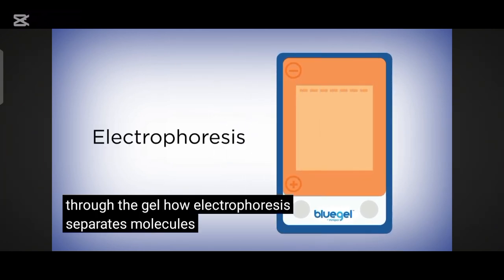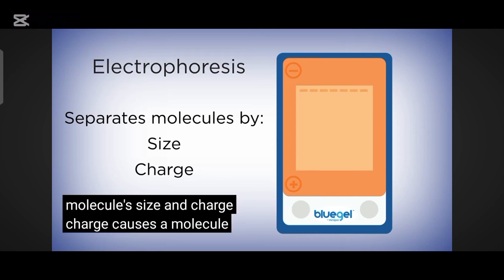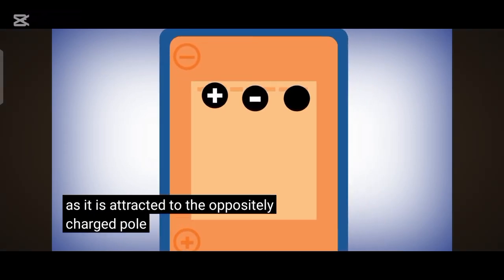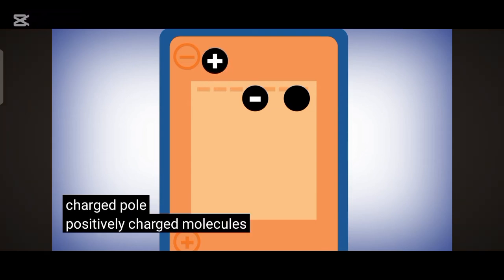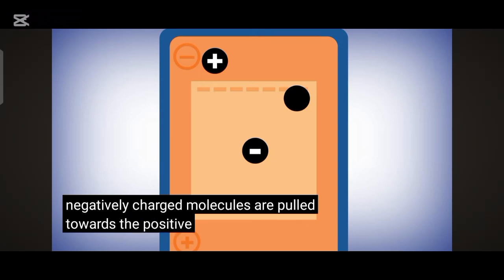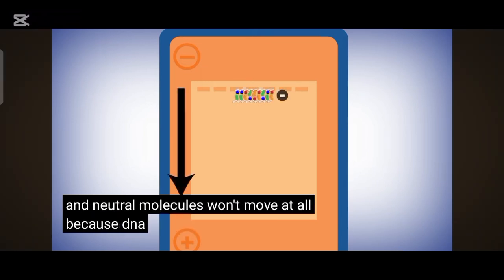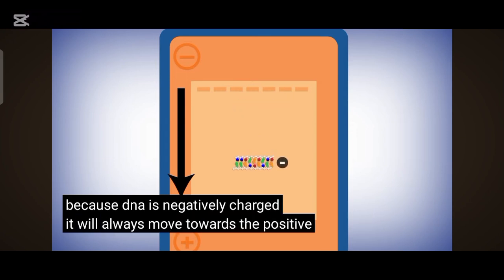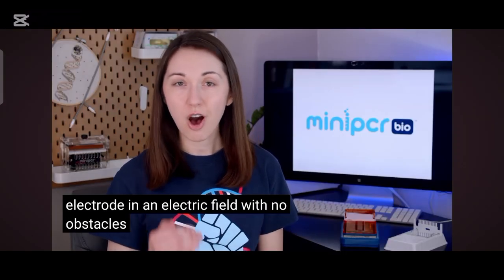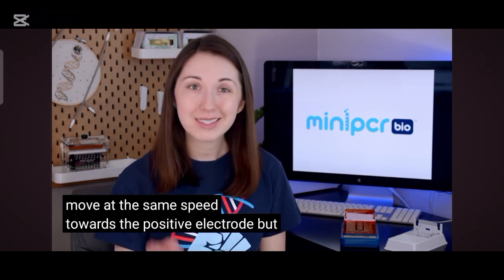How electrophoresis separates molecules is affected by the molecule's size and charge. Charge causes a molecule to move through an electrophoresis gel as it is attracted to the oppositely charged pole. Positively charged molecules are pulled towards the negative electrode, negatively charged molecules are pulled towards the positive electrode, and neutral molecules won't move at all. Because DNA is negatively charged, it will always move towards the positive electrode in an electric field.